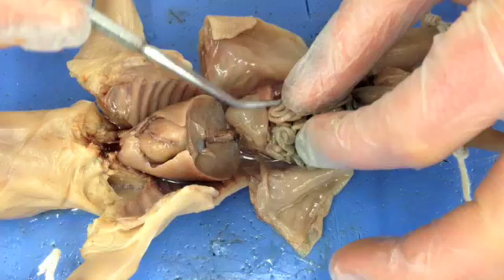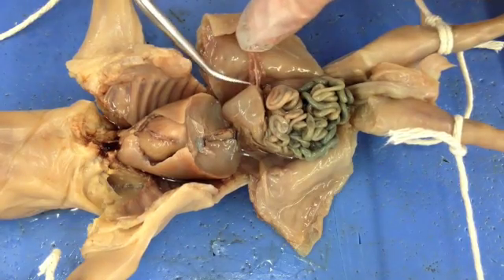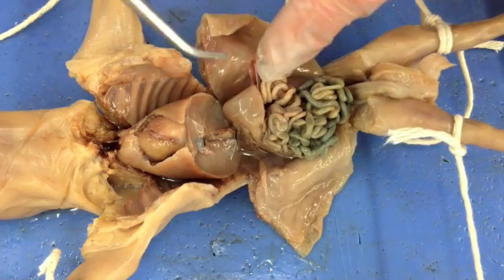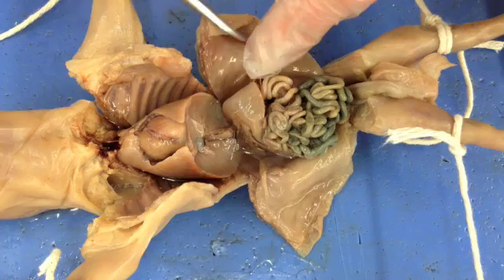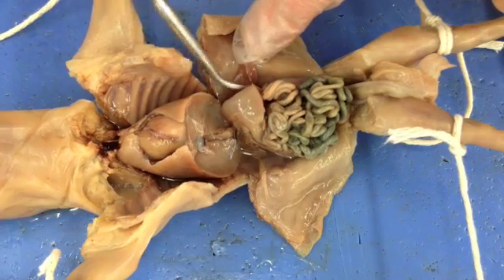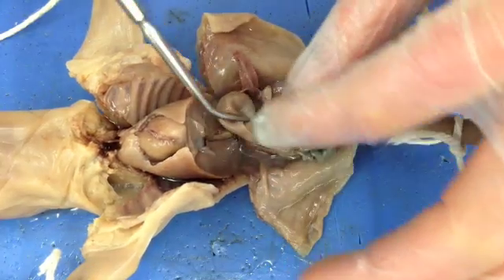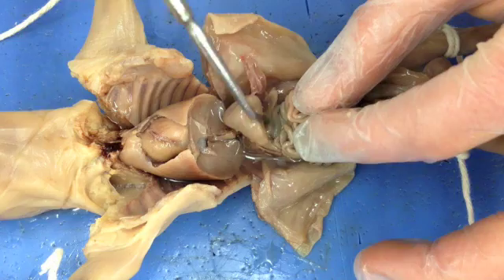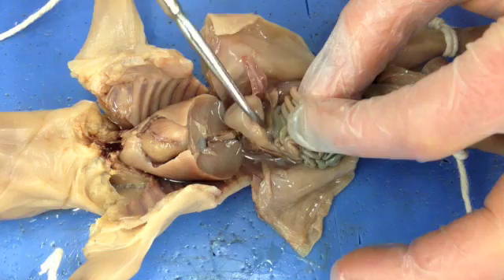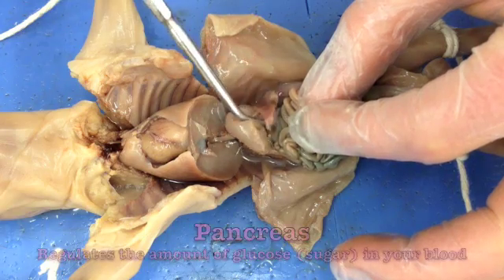Then if you pull that spleen back, you can see all this stuff right here. This is connective tissue. Everything is held together so it's not flopping all over the place as you're moving around, jumping, and just doing daily activities. So we just slowly pull that away. This structure right here at the end of the probe — as I move it across — that is your pancreas.